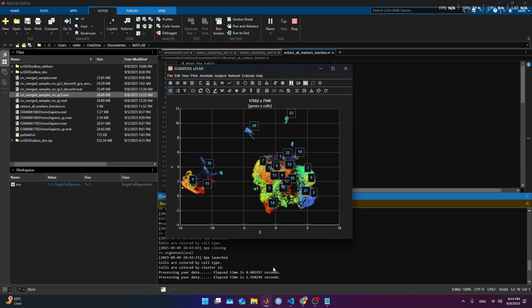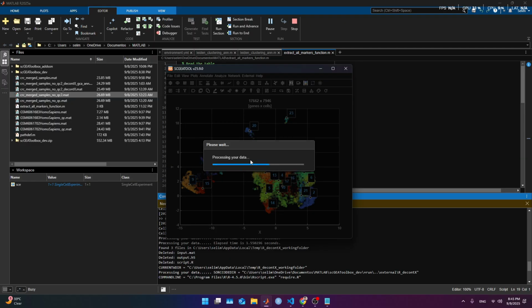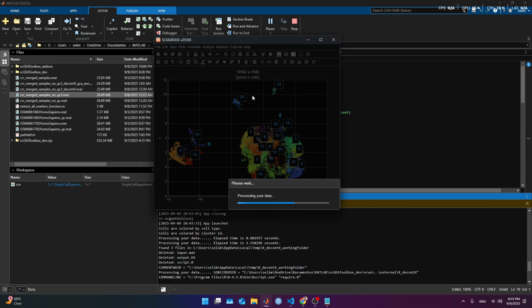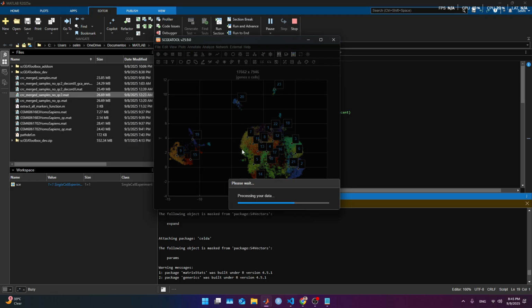And we hit on it, and it might take some time. Oh, sorry. Here, continue. Use the default for storing data temporarily, and that might take quite some minutes, within 10 to 20 minutes, depending on the size of the sample. It's gonna call an R function and it's gonna do decontX. It's a really good pipeline we usually use in the single cell data core. And it's computing it. I'm gonna stop it until it finishes.